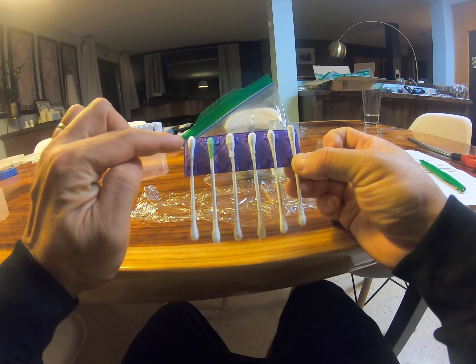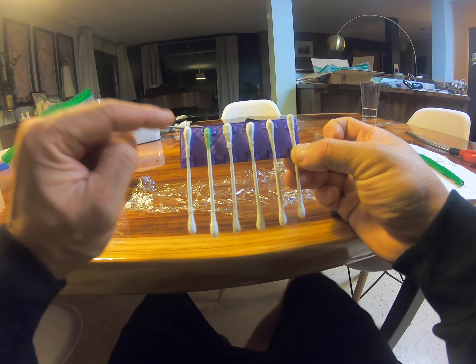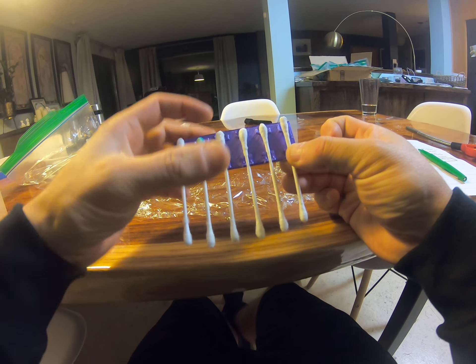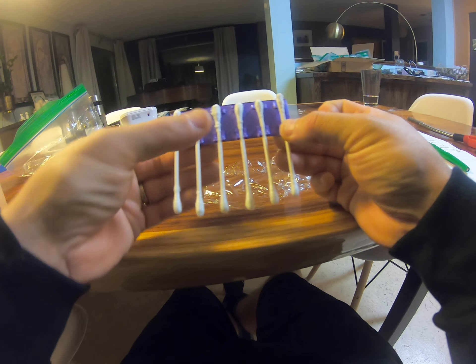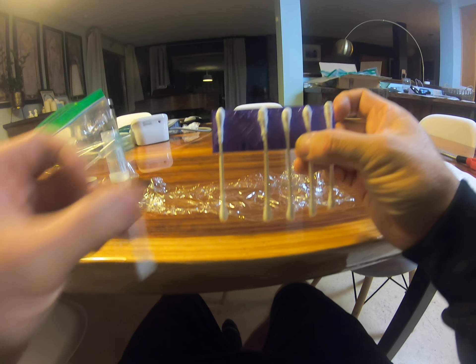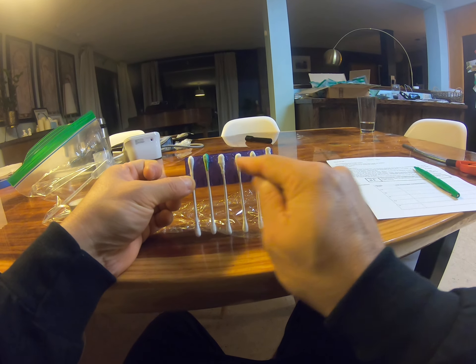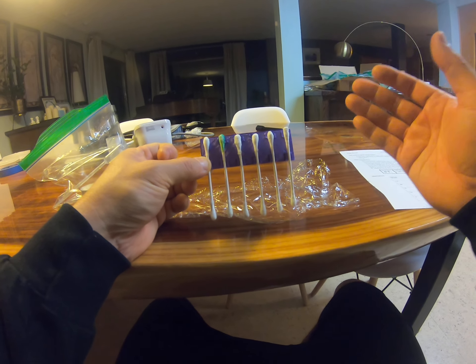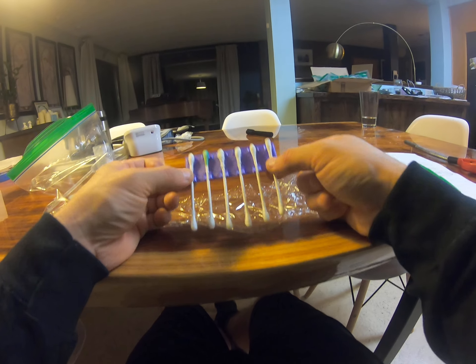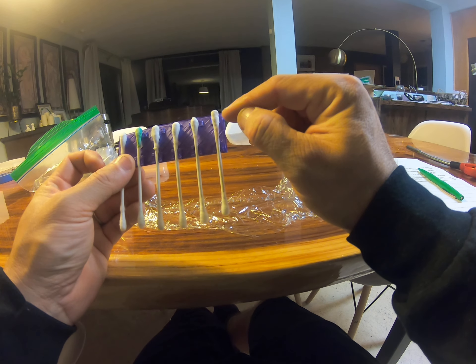So I would initial N-F. Opening this up, you will have — and you're going to be careful with these because I don't want you to mix them up — your metal samples. There are actually five samples and a blank. You can carefully unwrap them, although some of these samples are hygroscopic — they will grab water from the air and kind of become a soupy mess. Their tips are coated with metal chloride salts, so different salts containing different metals. This first one is called a blank — it contains no salt, so this is just a Q-tip. Whenever there are no chemicals being studied in a sample, we call that sample a blank.